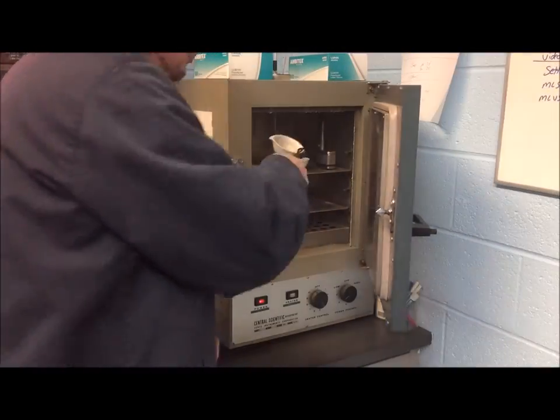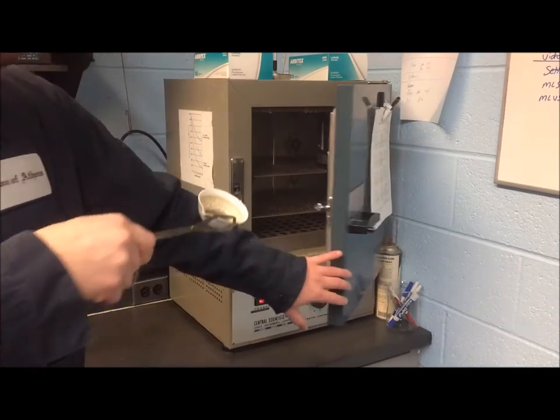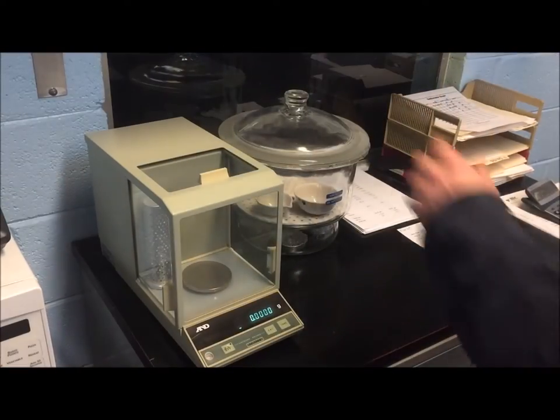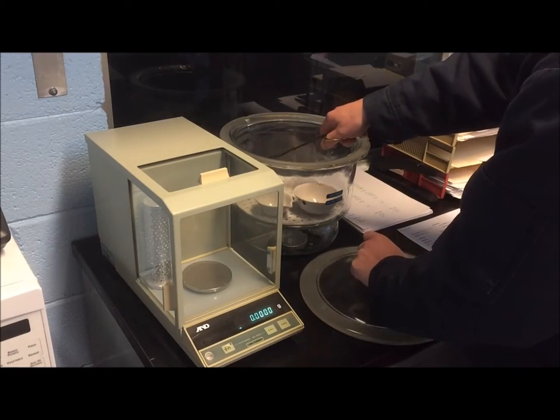After some more TV magic, the next day the samples are removed from the oven. They are placed in the desiccator to cool without absorbing any moisture for at least 30 minutes.